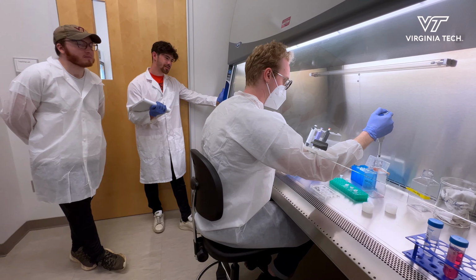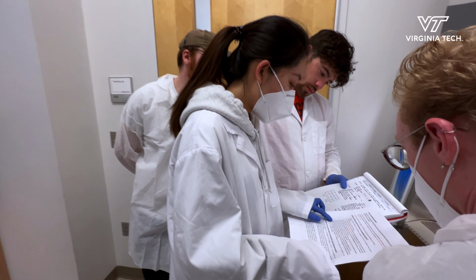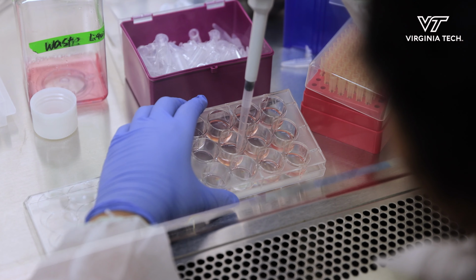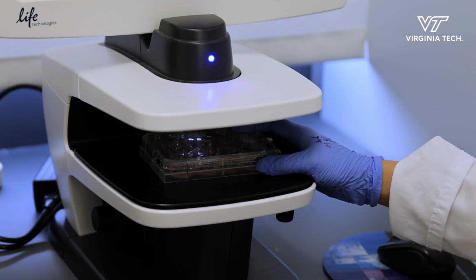And we used to do that for students in the past, but last year because of COVID, and then there's the Pfizer and the Moderna vaccine developed, and the students are interested in learning what are the components in those liposomes. So we designed this module where the students can actually fabricate the lipid nanoparticles. So the DNA plasmid is inside the lipid nanoparticles.